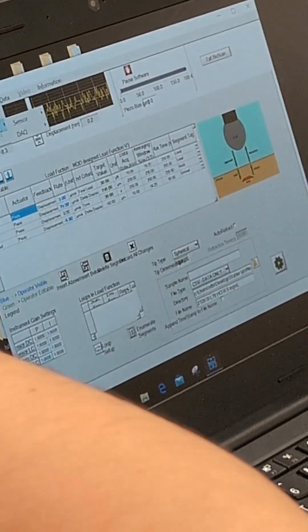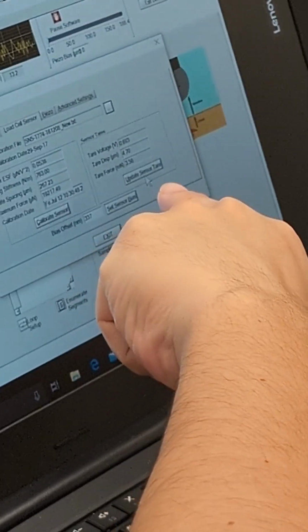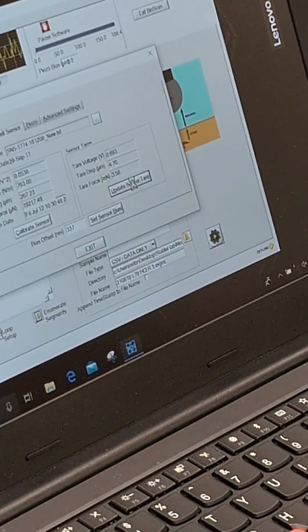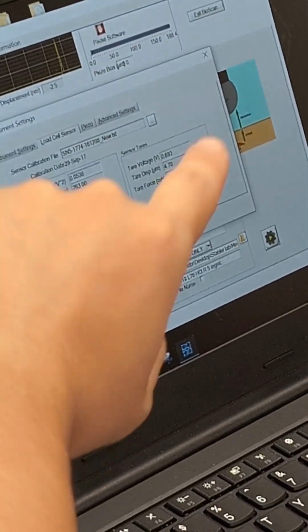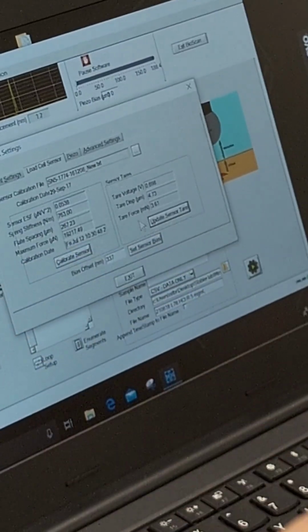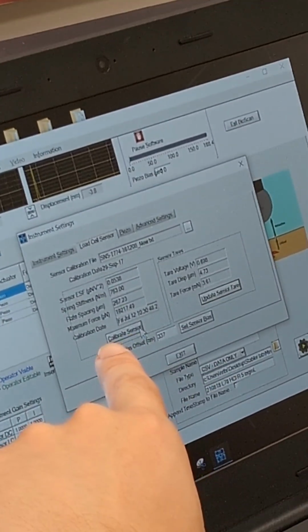There's another way that you can do calibration: click on instrument setting and then go to load cell sensor. Another thing to do is you want to update the sensor tare. I find that this sometimes helps me a lot by just asking to reload certain forces. And then after that, do another calibration. Every time you do a calibrate sensor, it will update the sensor tare. But you can always tare it first and then do a calibration to save you a little bit more time. So I'm going to just go with the calibrate sensor again.